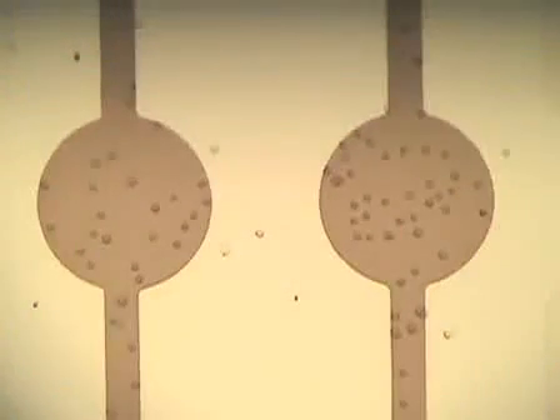Hi, I'm Sunny Shah. I am a second year graduate student in Dr. Rebson's lab. We are here at the Department of Biomedical Engineering at University of California, Davis. Today, I'm going to show you the controlling of cell adhesion on microfabricated, optically transparent indium-tin oxide electrodes.